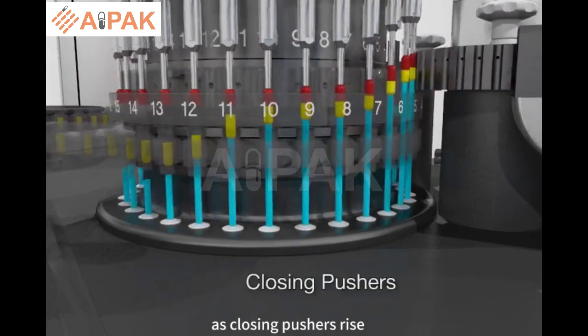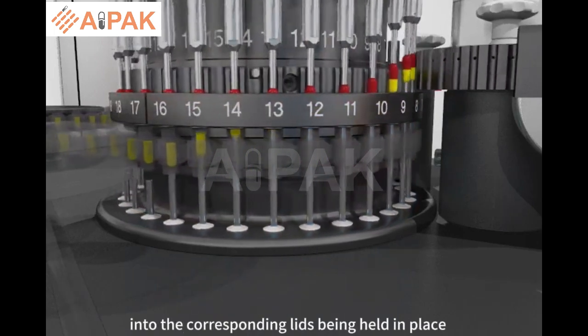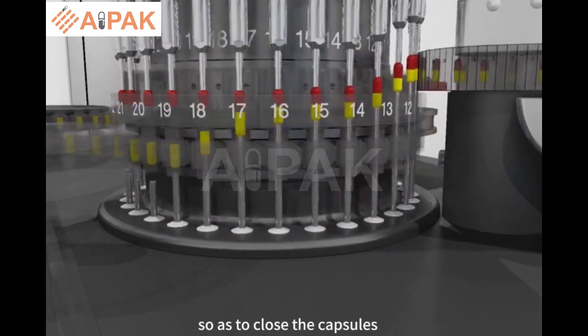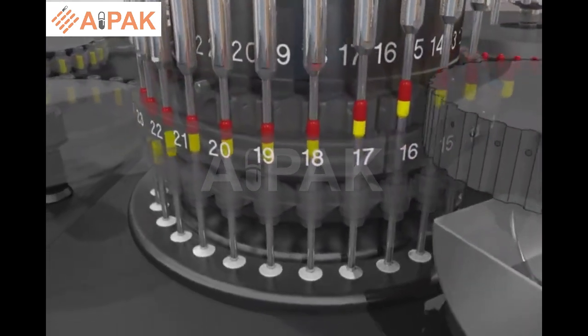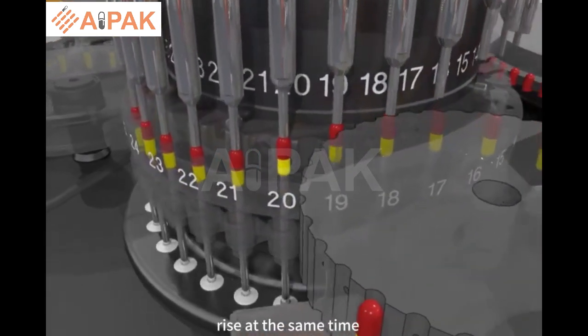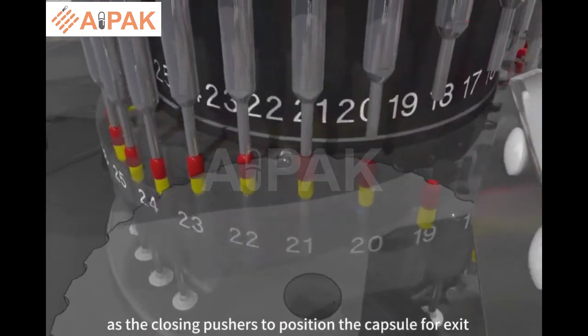As closing pushers rise, they push the bodies of the capsules into the corresponding lids, being held in place by the contrast pushers so as to close the capsules. The contrast pushers continue to rise at the same time as the closing pushers to position the capsule for exit.